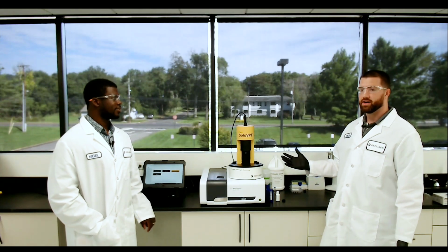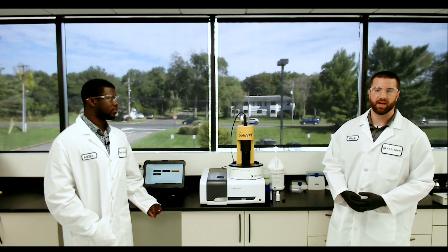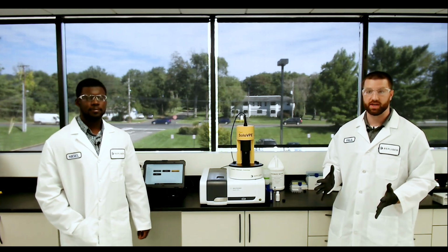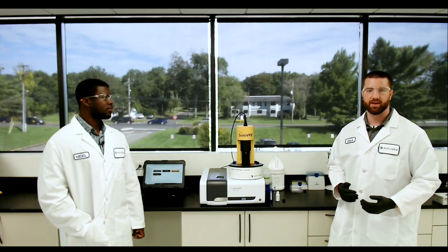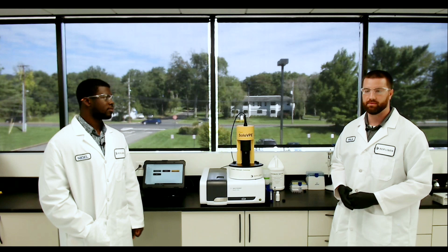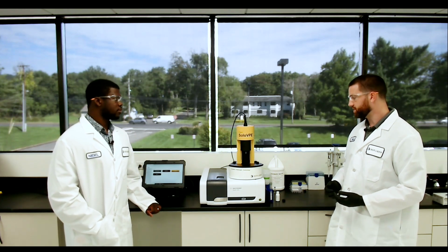Thanks for setting up the software, Nigel. It's very important to set up the software parameters first, just so we have the software ready. So as soon as our sample's ready, we can just put it into the holder and click play. We don't want to give any time for that sample to settle or evaporate. So first thing I'm going to do to run this sample is insert my fibrette.